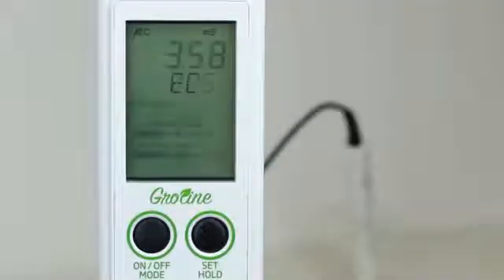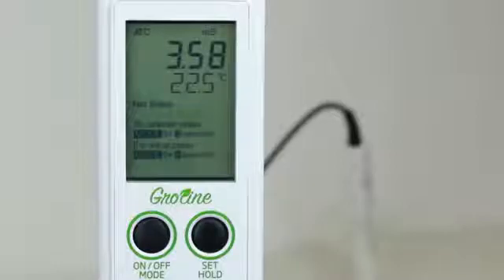For multiple samples, it is important to rinse the probe between each sample to avoid cross-contamination.